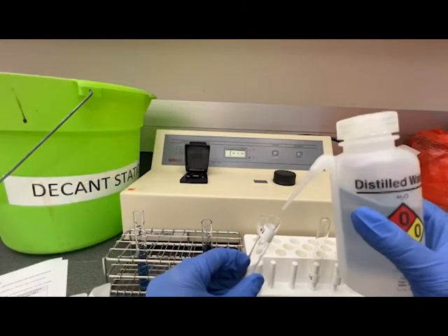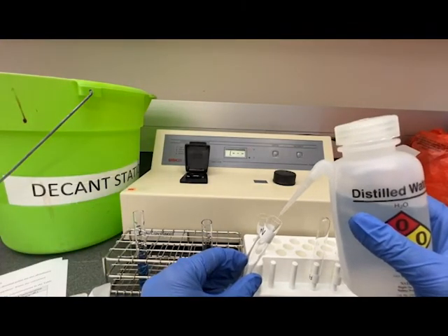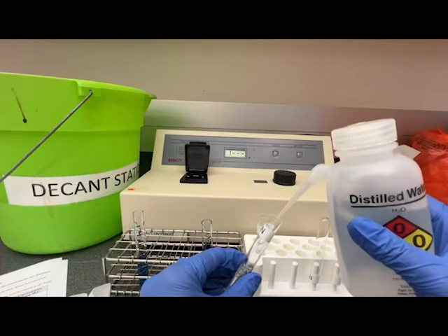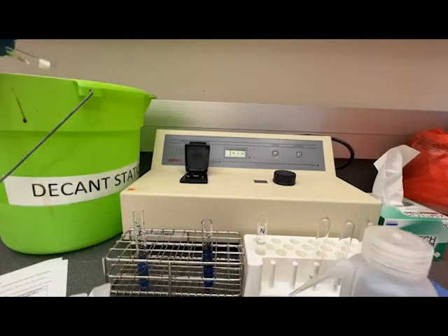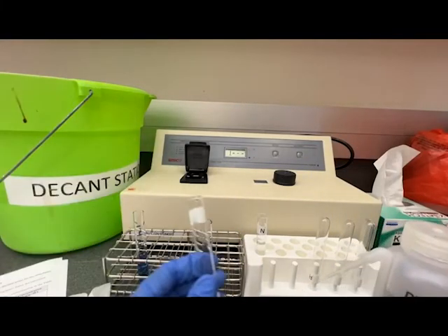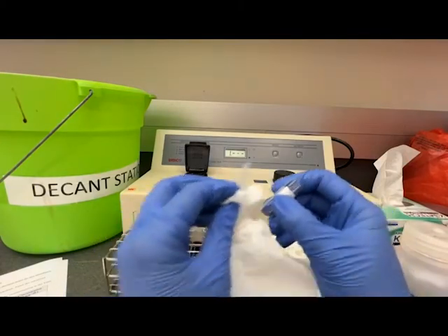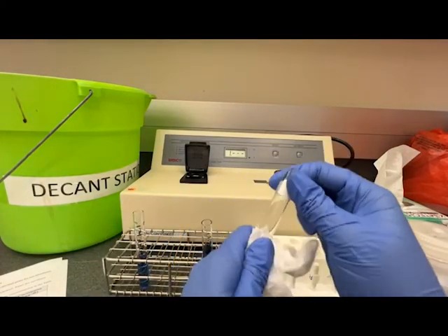For this particular series I went one to four. I measured the one to four or the more dilute sample and then the one to two. I could have elected not to rinse the cuvettes between samples because I was going from the lowest concentration to the highest concentration.